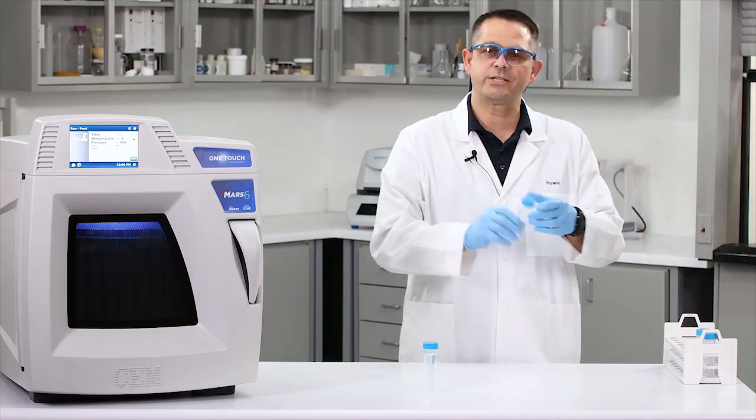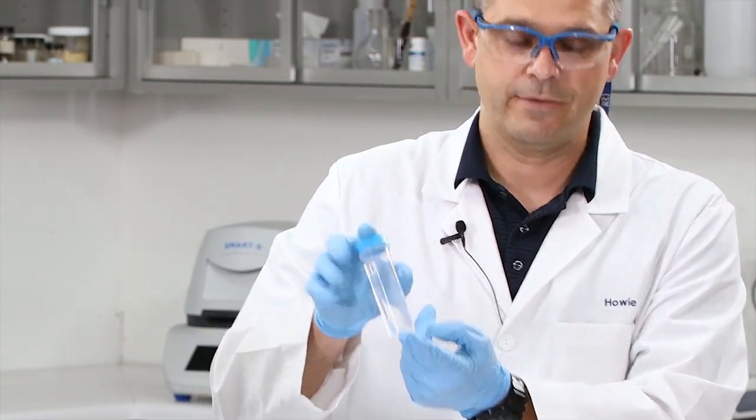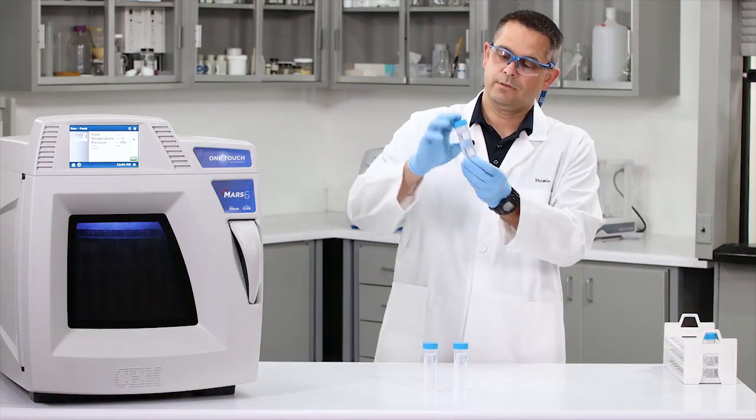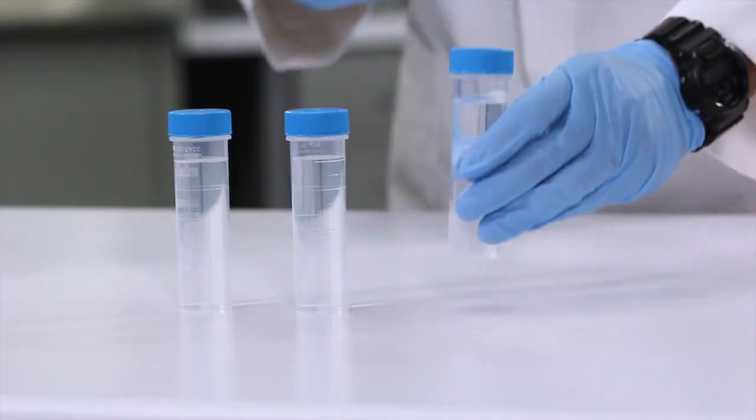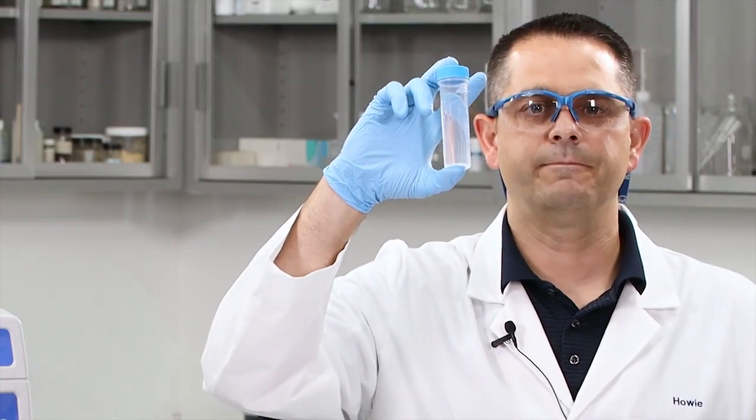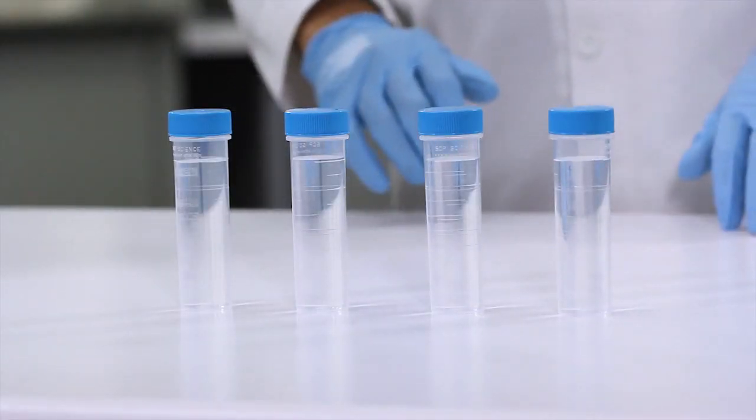Now we have our cheese sample - again, fantastic digest quality. Here's our lollipop - clear, colorless, and particle-free as well. And our last one, this was the beef jerky. Looks like water. So all of these, clear, colorless, particle-free, and ready for analysis.